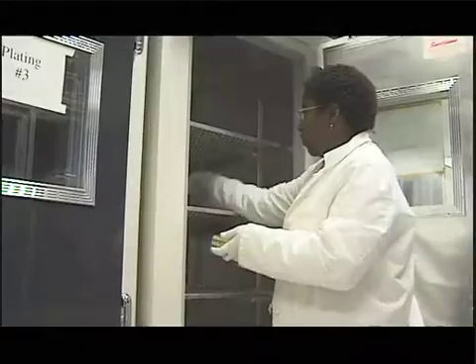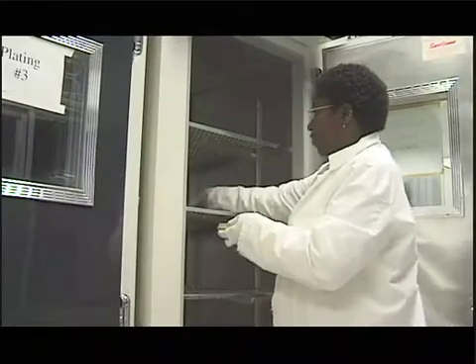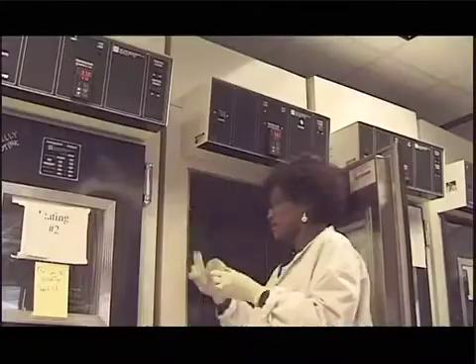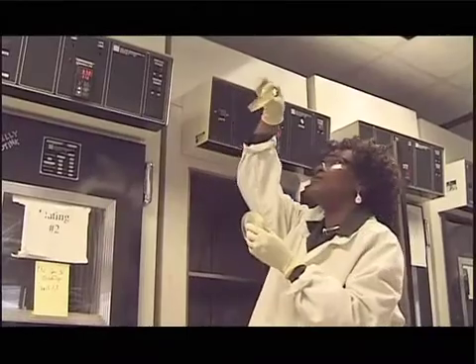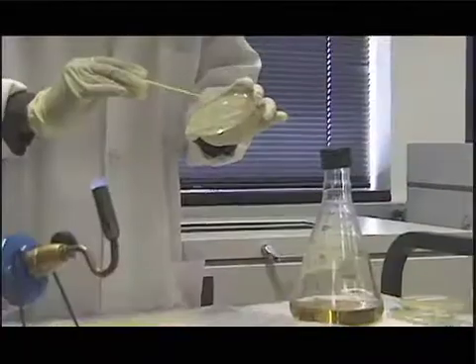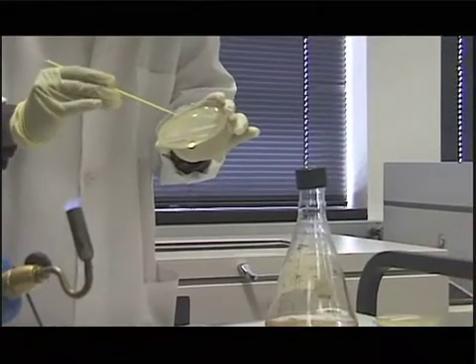These plates are placed in a 37 degree incubator and grown overnight. The next morning, a technician from library core removes the plates and picks single colonies to inoculate 250 milliliter liquid cultures.